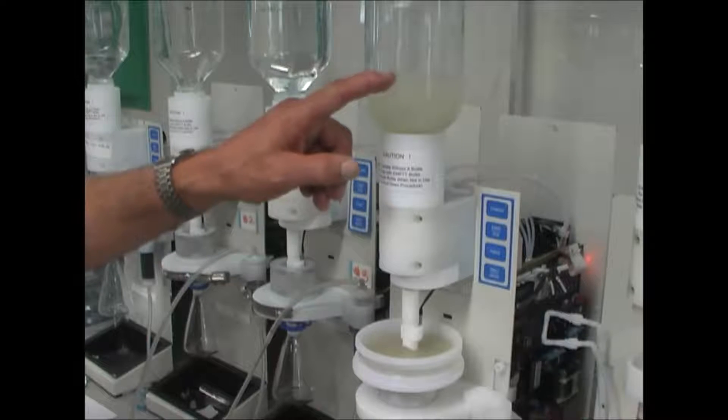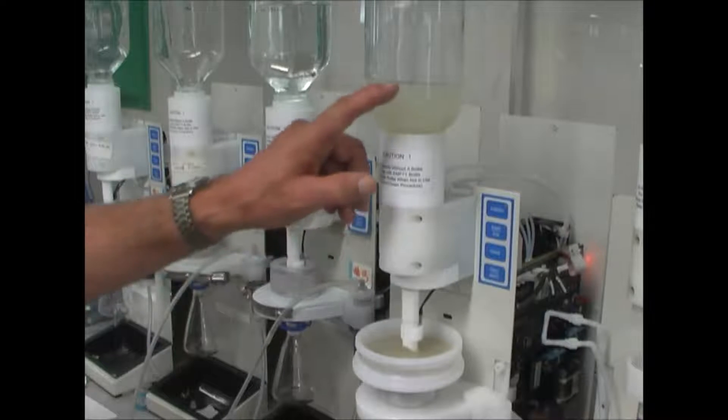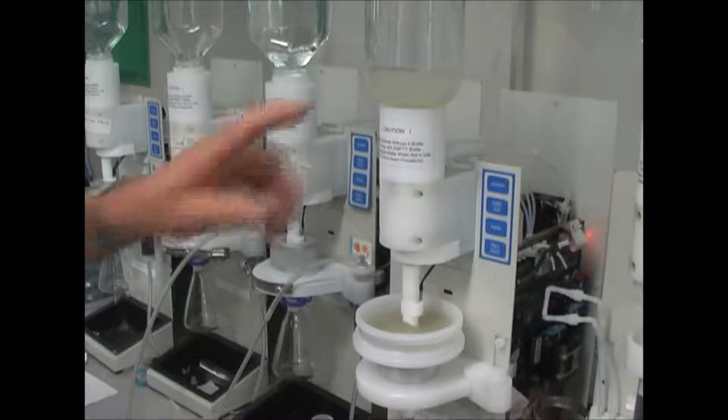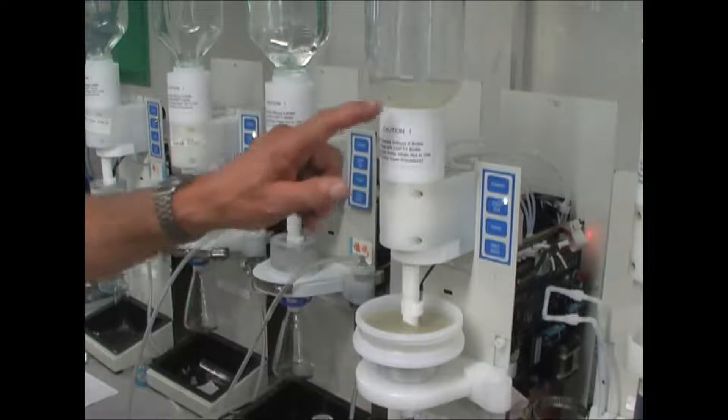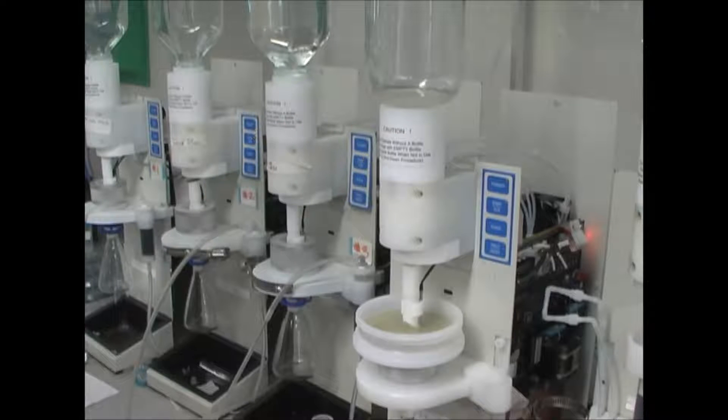Six minutes, seven minutes, eight minutes, nine minutes, that's ten minutes, we can see that we're almost empty with the bottle.